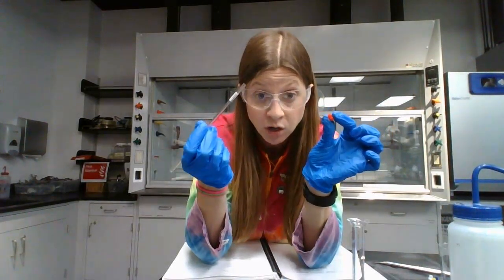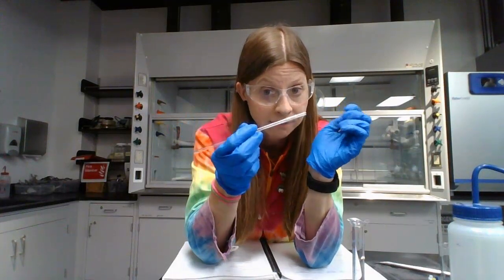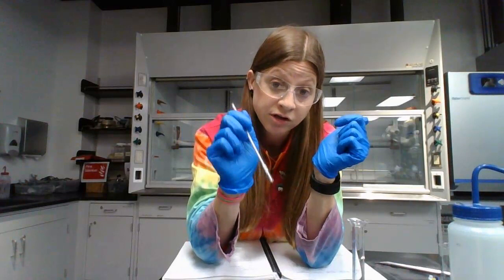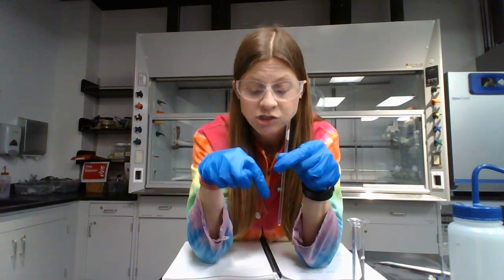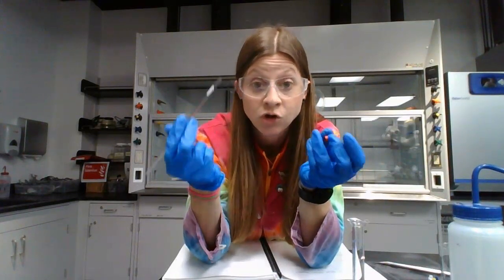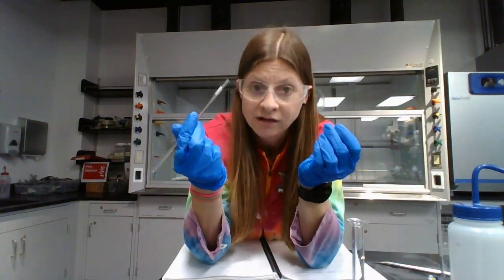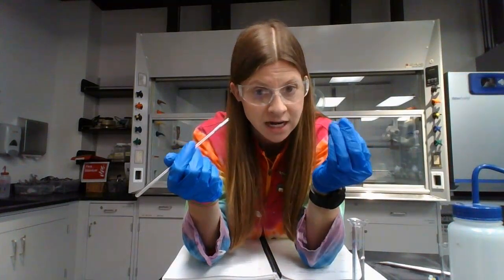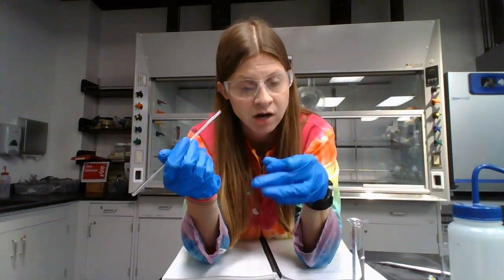They're very challenging to wash. So the ones with the sodium chloride, you don't have to wash them. Just put them away. The one that had the chicken broth or Pedialyte, once you've shaken out the chicken broth or Pedialyte, squirt some water in there and then shake it out. What we're trying to do is get the food things out. We don't want these to mold while we're waiting to be able to wash them because we have a washer for them, but we can only do a few at a time. So it's a slow process to get through all the NMR tubes.